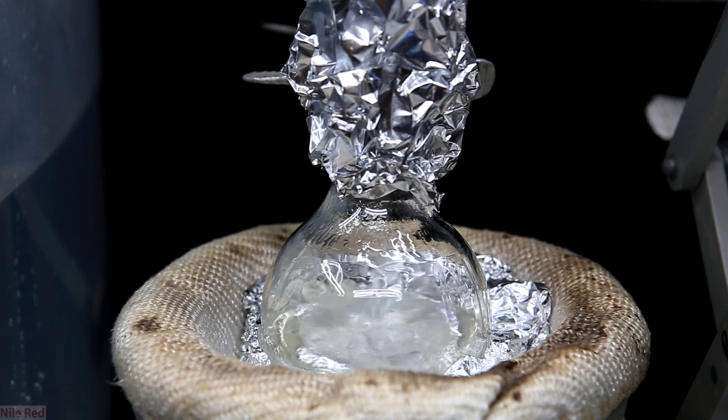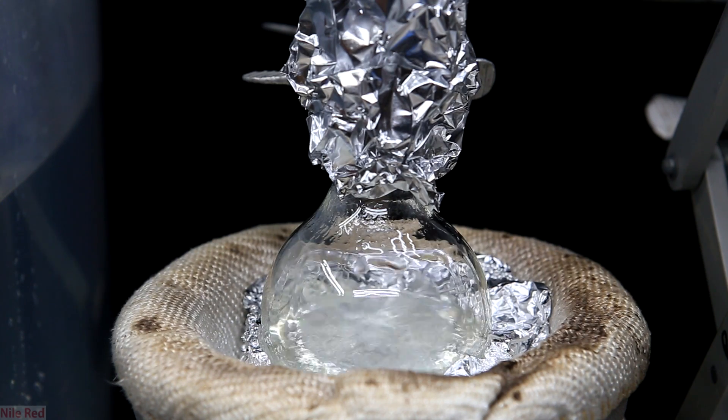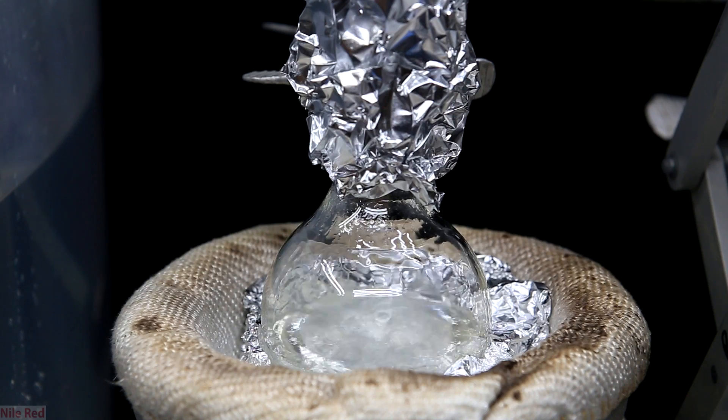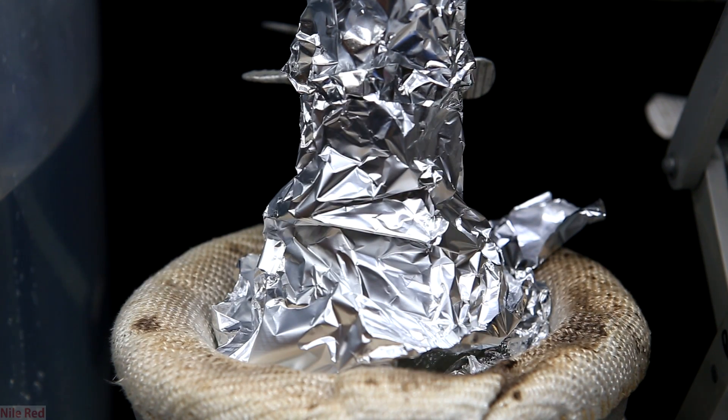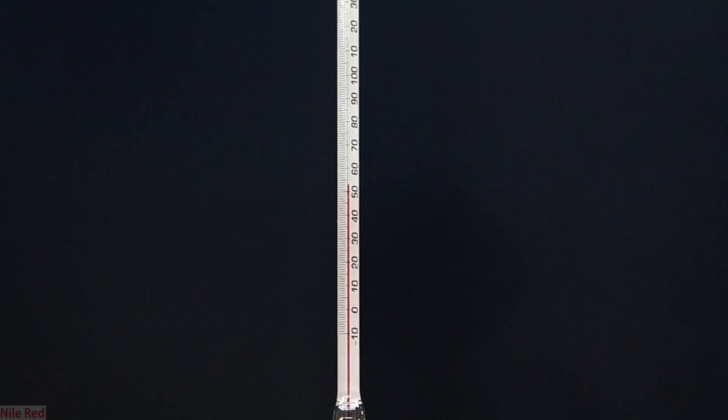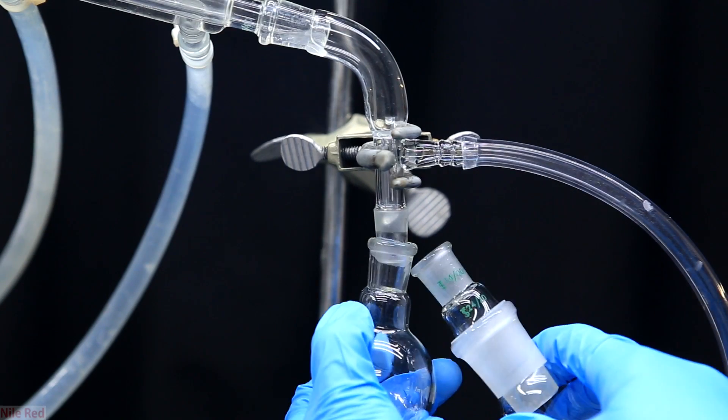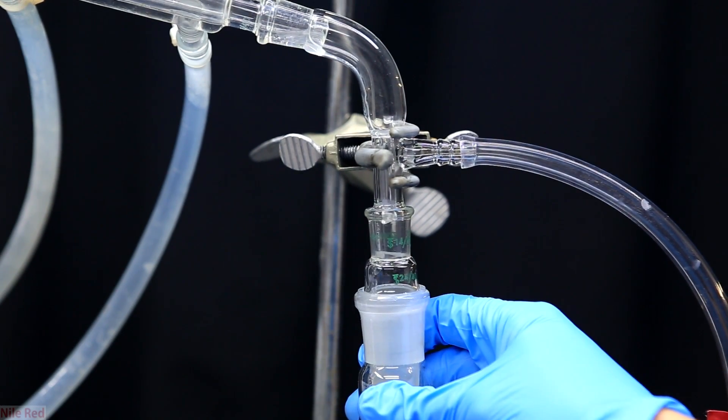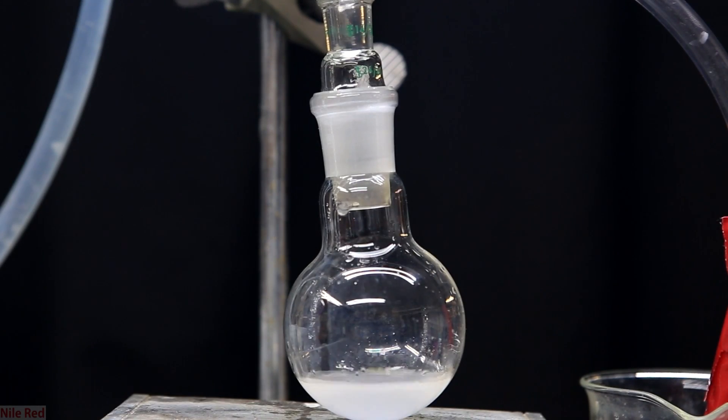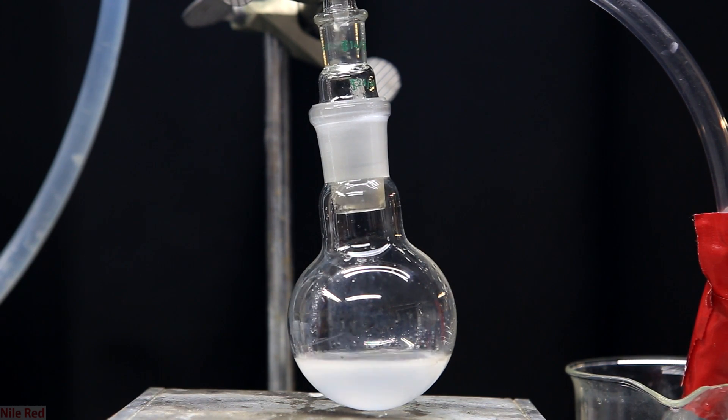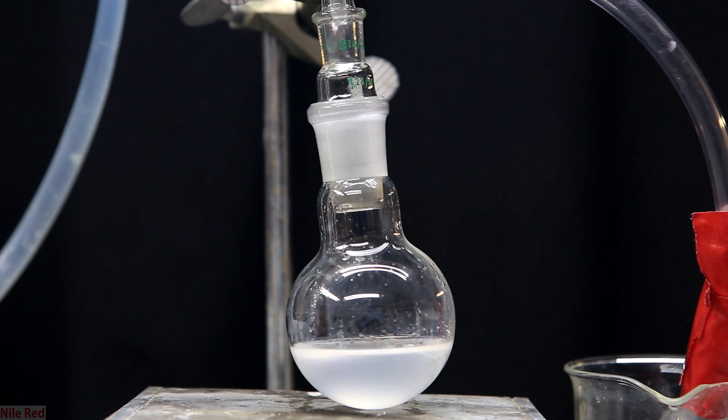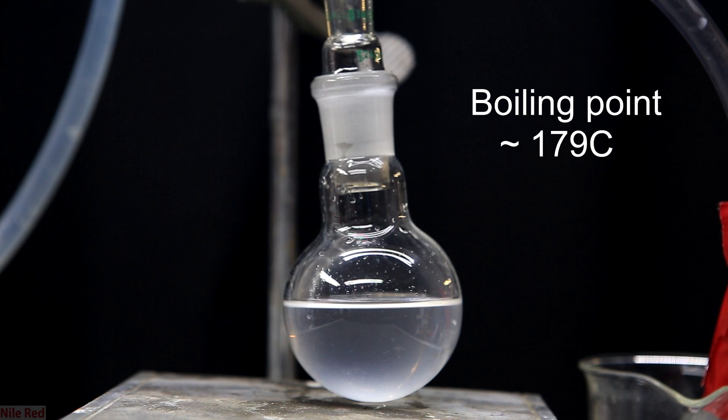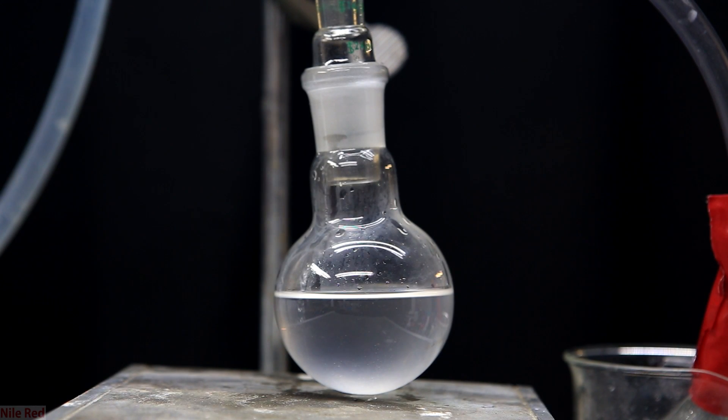After a short period of time you can see we have a pretty violent boil going on in the flask. You can actually see where the benzyl chloride is recondensing on the colder part of the glass. It's going to take a little while because the benzyl chloride is going to have to warm up the entire flask and the entire column before anything passes over. We have to look closely at the temperature of the thermometer and we only start collecting at around 177 degrees Celsius. Everything that comes over below this temperature is discarded. So when we hit 177 degrees Celsius I quickly remove the round bottom flask and place on a new one. We fix this round bottom flask in place and we keep collecting. We collect everything between 177 degrees Celsius and about 180. The moment the temperature goes up higher than 180 degrees Celsius we stop the distillation and we remove our flask. Benzyl chloride has a boiling point of around 179 so the bracket of 177 to 180 is good. Collecting anything above or below this bracket would be contamination.